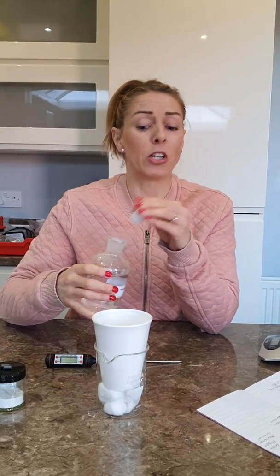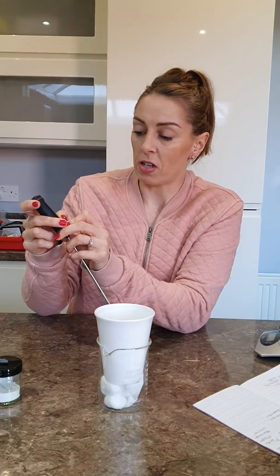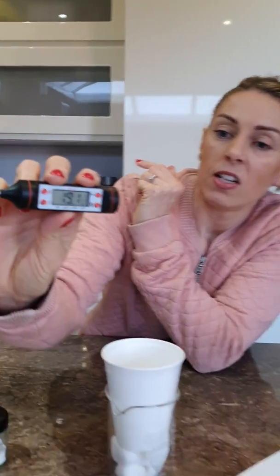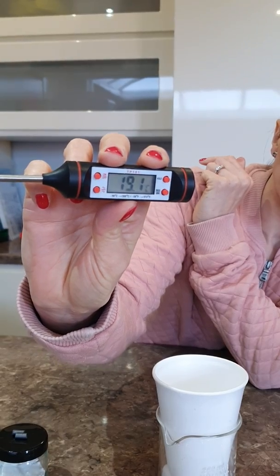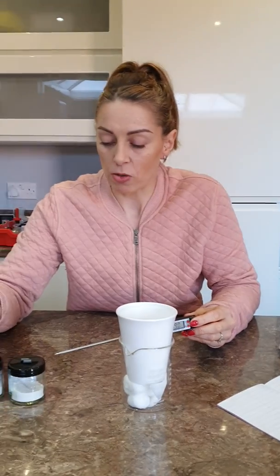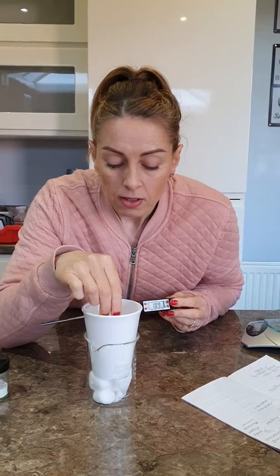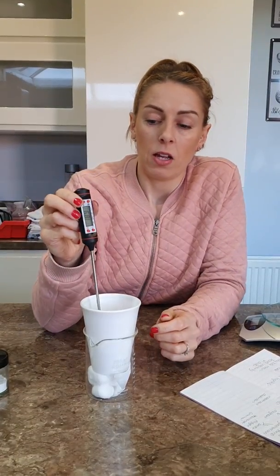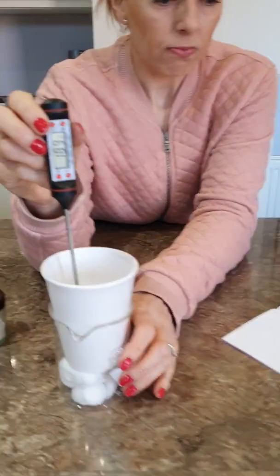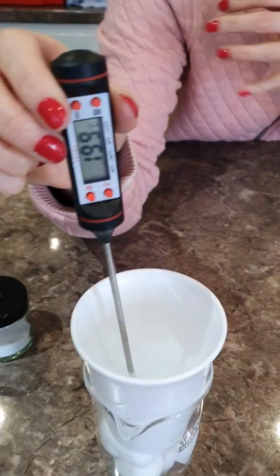I'm going to measure out 50 ml of hydrochloric acid using the measuring cylinder. I'll get my digital thermometer ready in degrees Celsius — you can see it reads 19.1 degrees centigrade. I'm going to start with some magnesium ribbon that I've previously weighed out and add that in, then watch the thermometer.